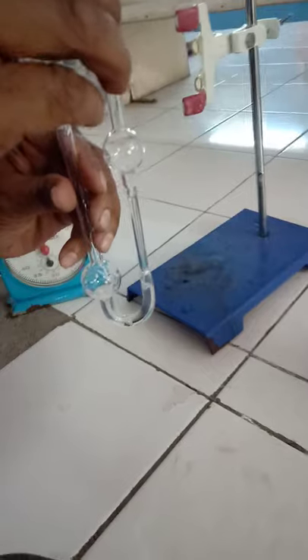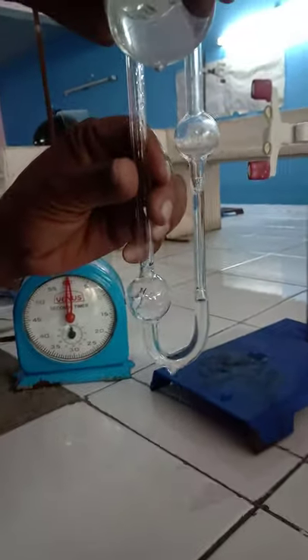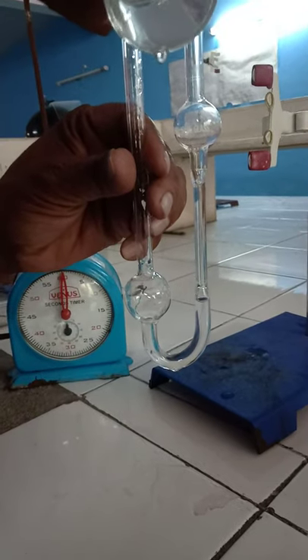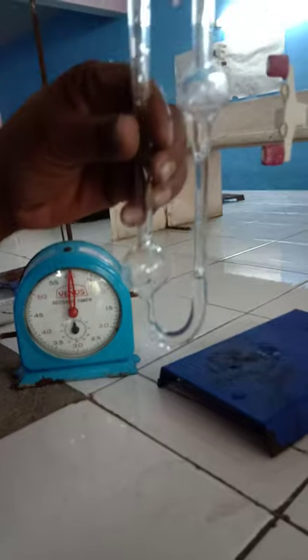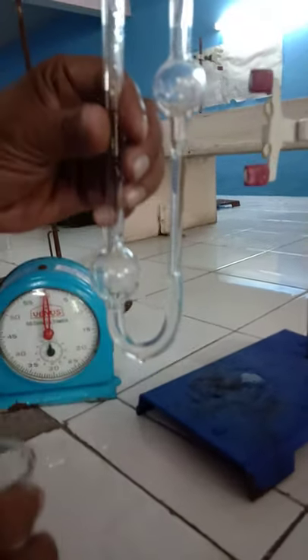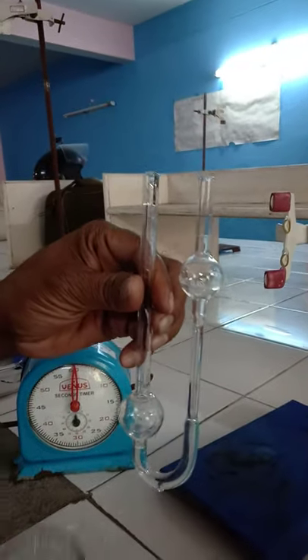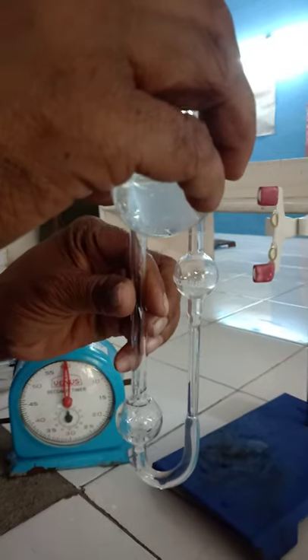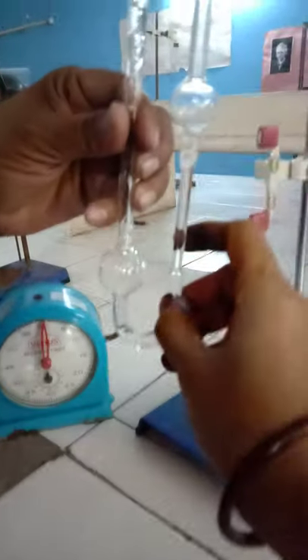For that purpose, we should take water through bulb A, which consists of the normal tube. Take some amount of water through bulb A up to bulb B. Whenever bulb B is half filled, we should stop the addition of water from the A side, because bulb B consists of a capillary tube.